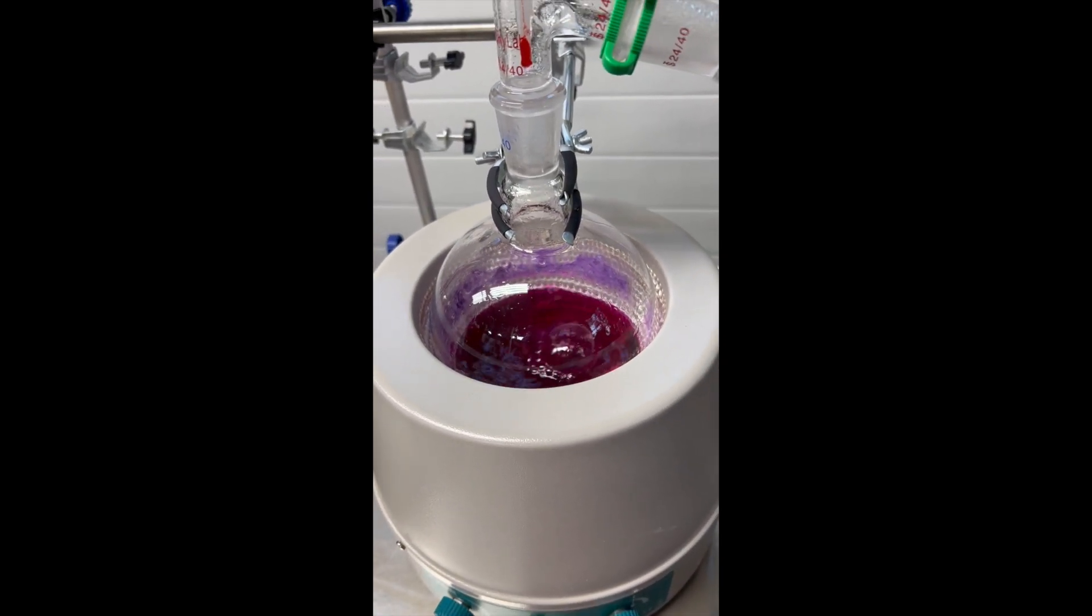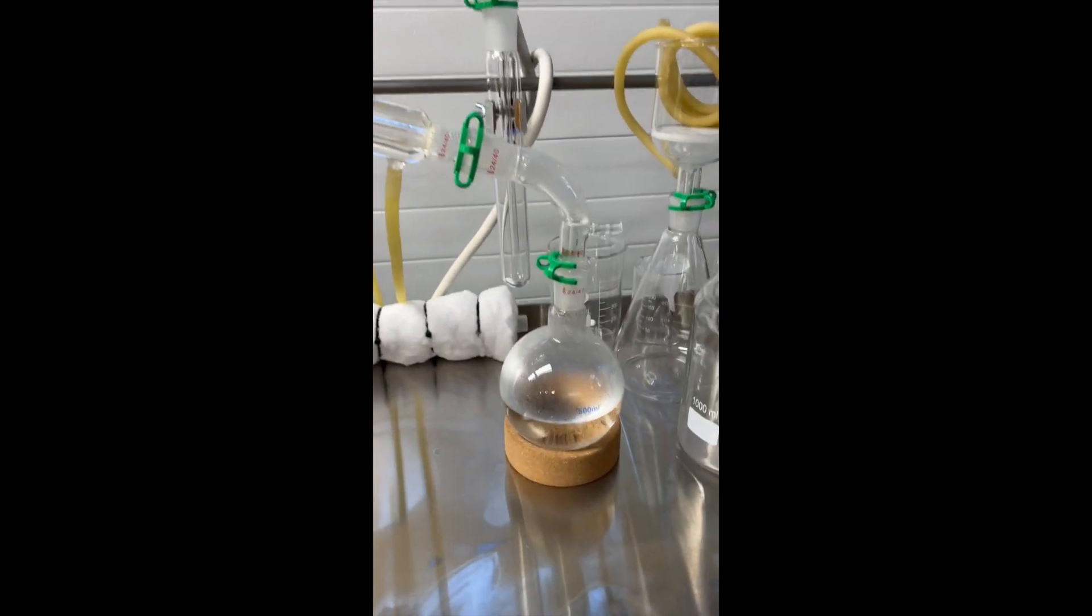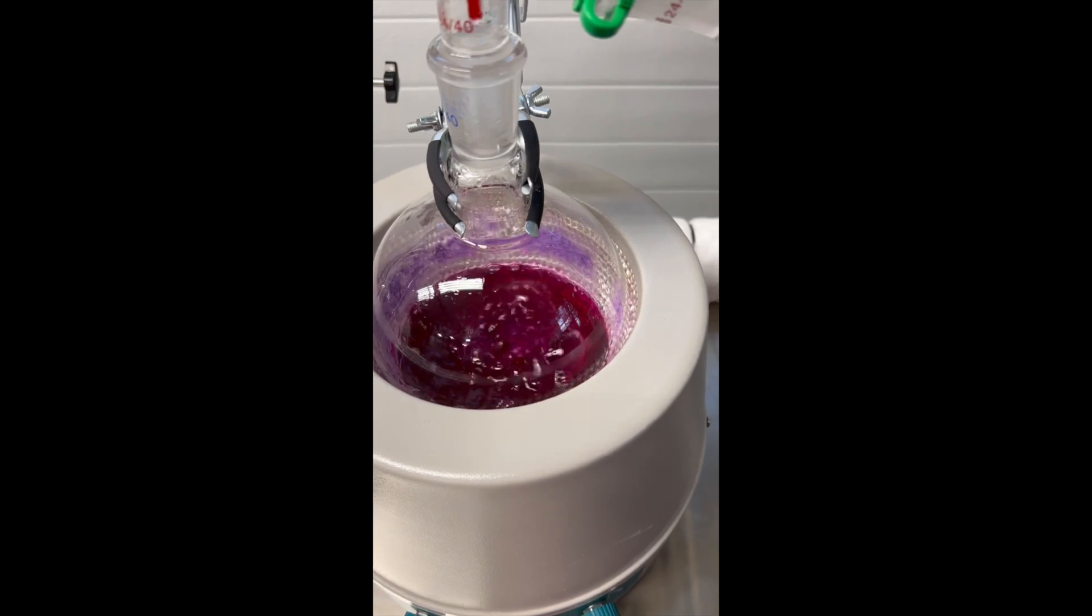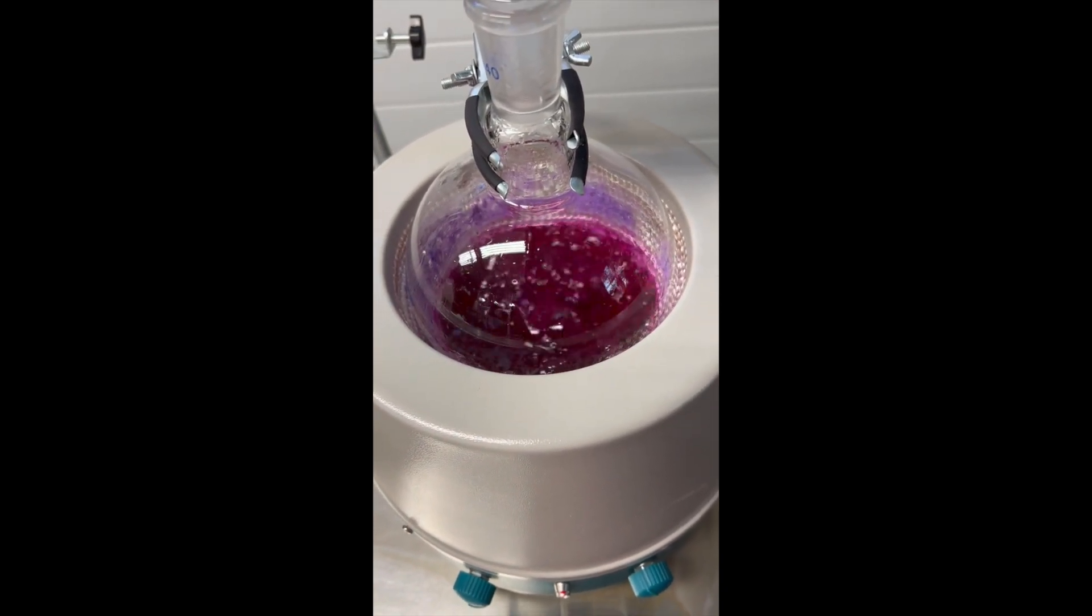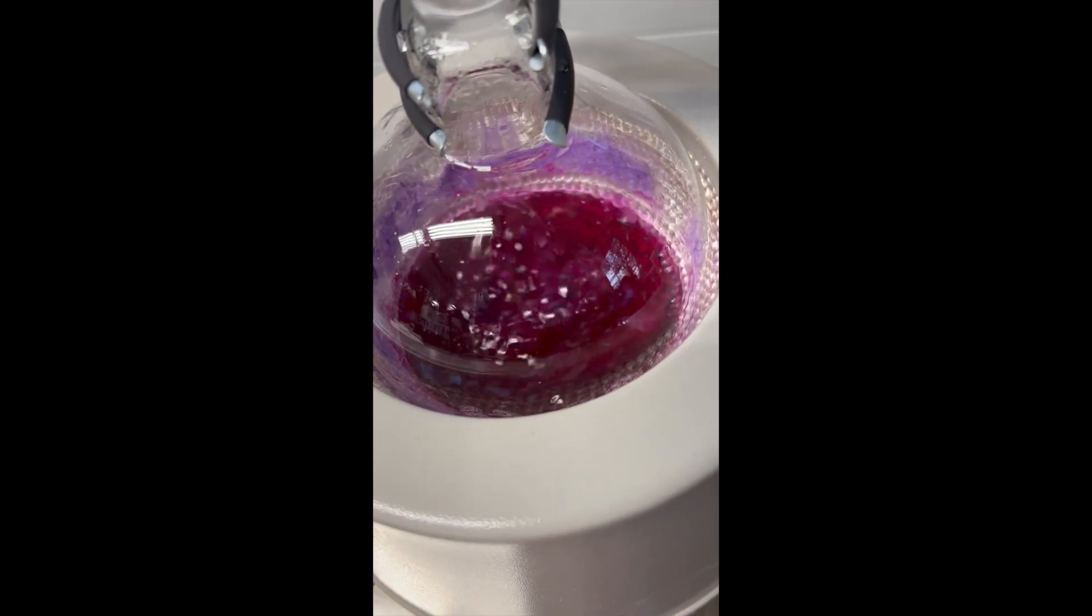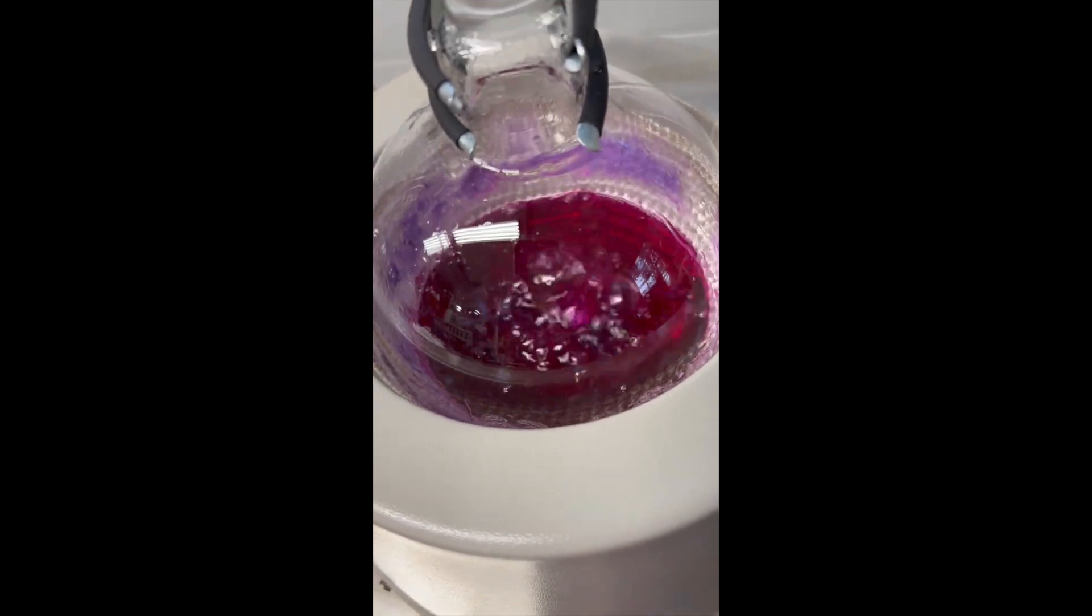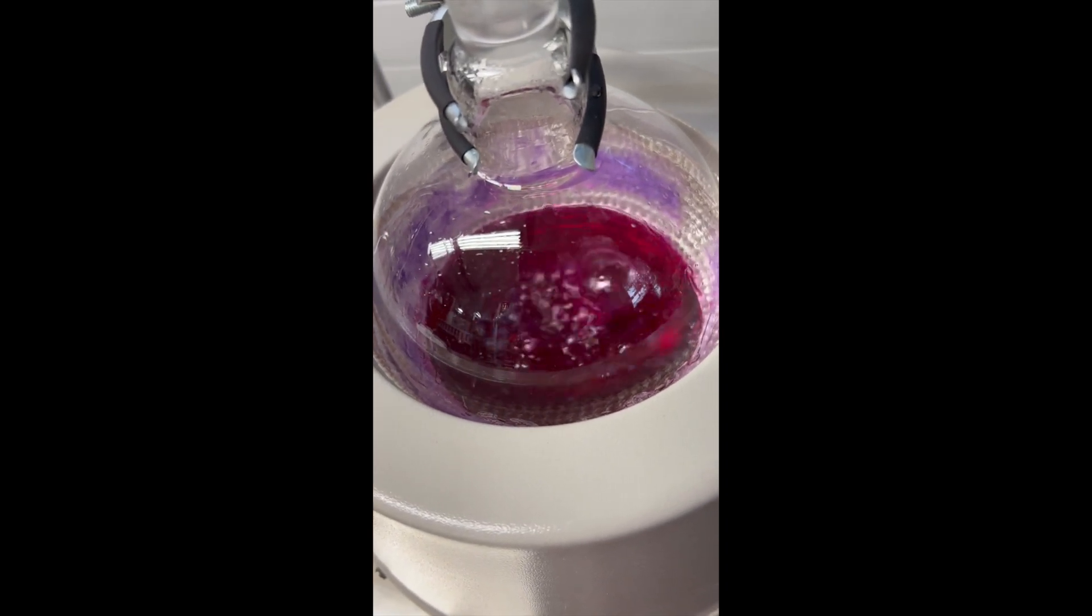It was clear, but as I'm boiling out the water, distilling out the water, it changed the pH back. So this eventually will boil down to a purple clump of salt, the sodium chloride.